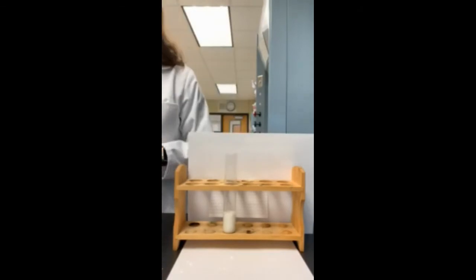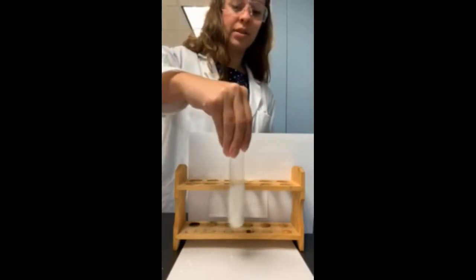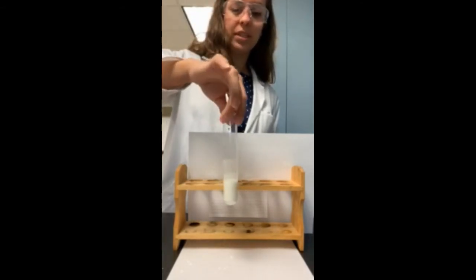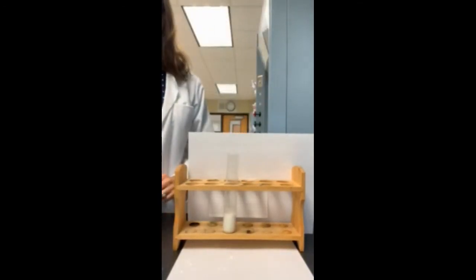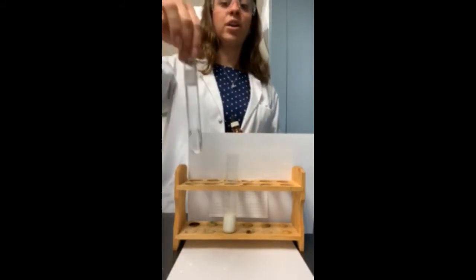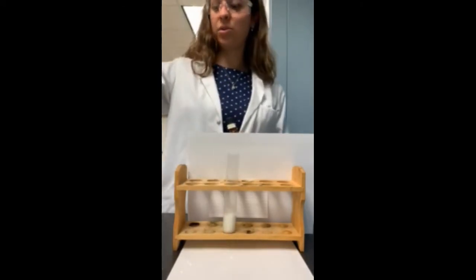So I added a couple pipettes of water to our test tube. Now, when I swirl this around, you can make some observations. It almost looks like a milky-ish liquid substance at this point. But to decide what we just formed, did we form an acid or a base, we're going to add our indicator. Remember, an indicator will be clear if it's in a neutral pH or an acidic solution.